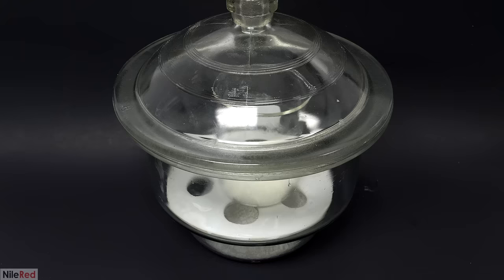As it warmed up, a lot of the solids started dissolving, but the most interesting part was the surface of the mixture. It had a really interesting pattern to it, and I probably stared at it for a little bit too long. Almost all the solid eventually dissolved, and it had this really dark solution. When I shot a light through it though, I could still see that there was some solid floating around. I let it go for another 5 minutes or so, but the solid was still there. So I just ended up adding about 100 more mils of the potassium hydroxide solution. In hindsight though, this probably wasn't necessary, and I should have just let it react for a little bit longer.